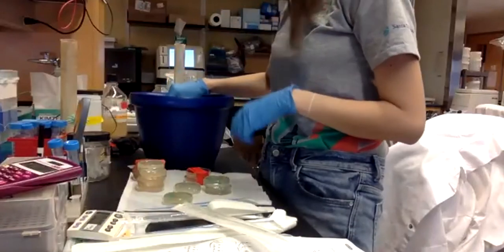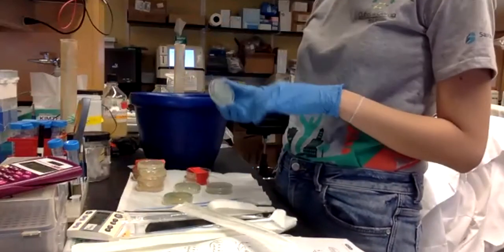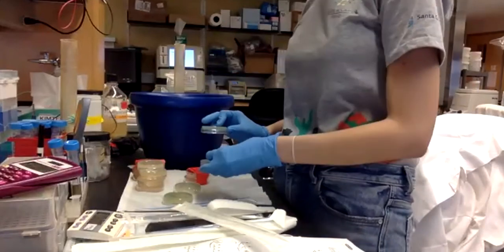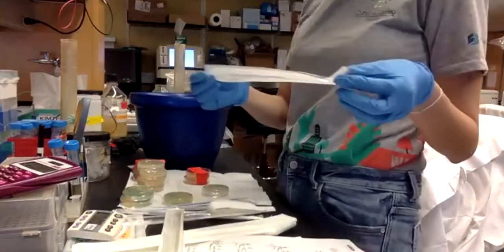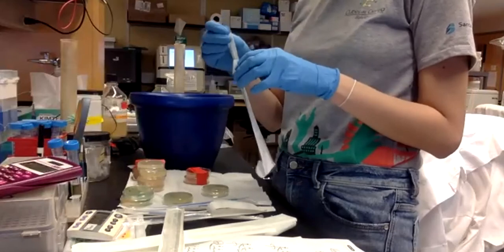So remember, maybe you can write it down, tube A and B. I'm putting bacteria that only has IPTG and X-gal, but no arabinose. And then tube C and tube D will have arabinose. So remember that for when you have to make the hypothesis of what's going to happen.